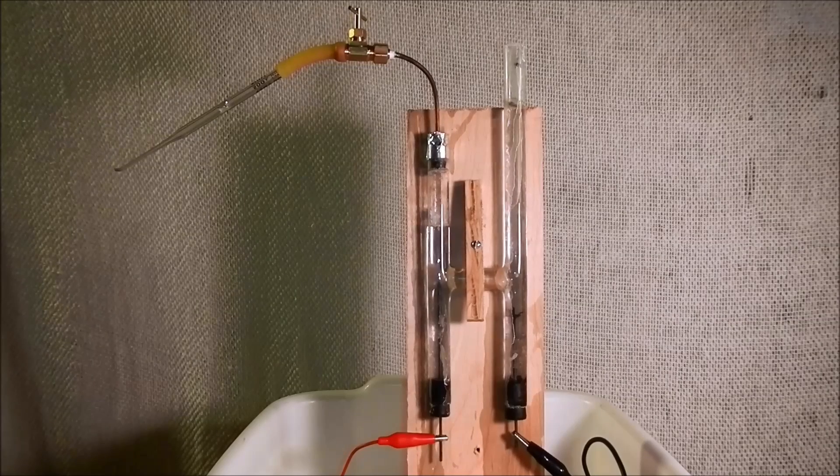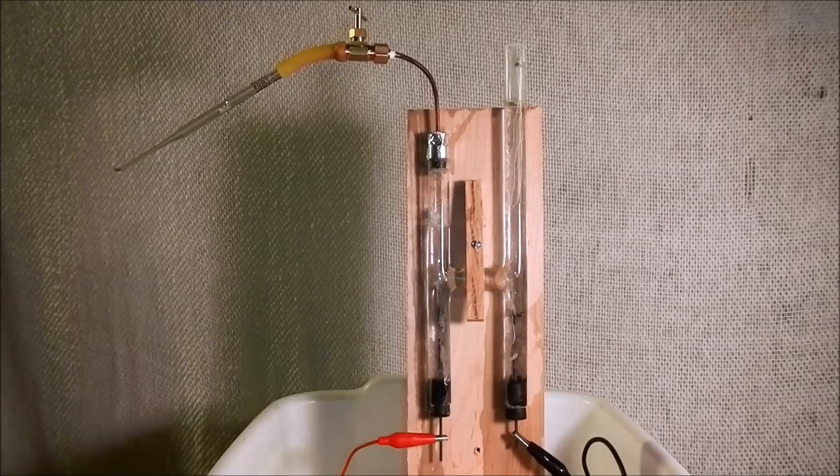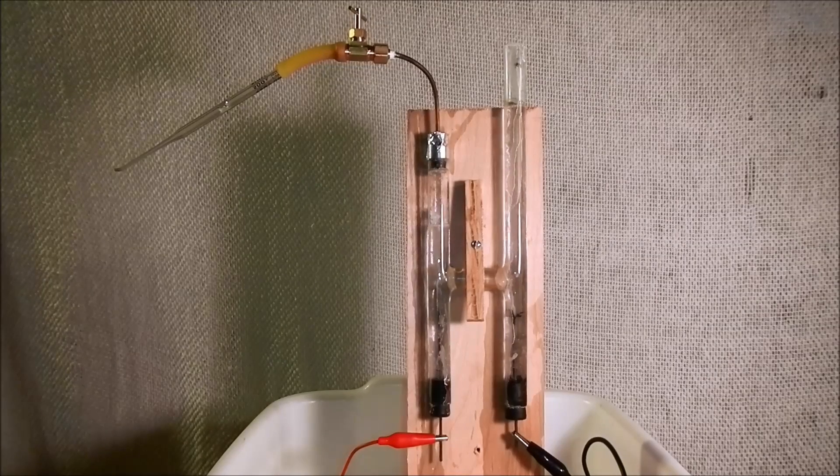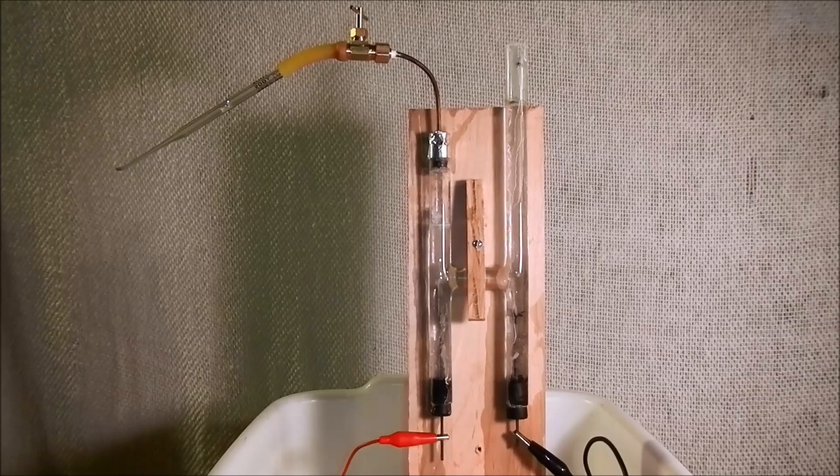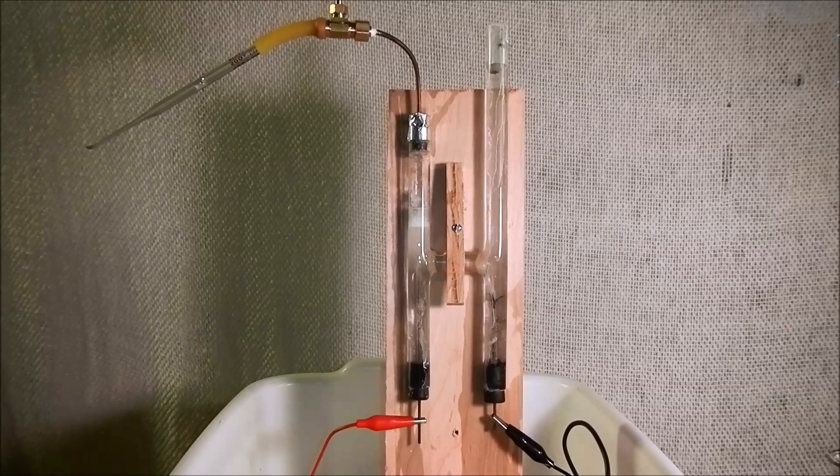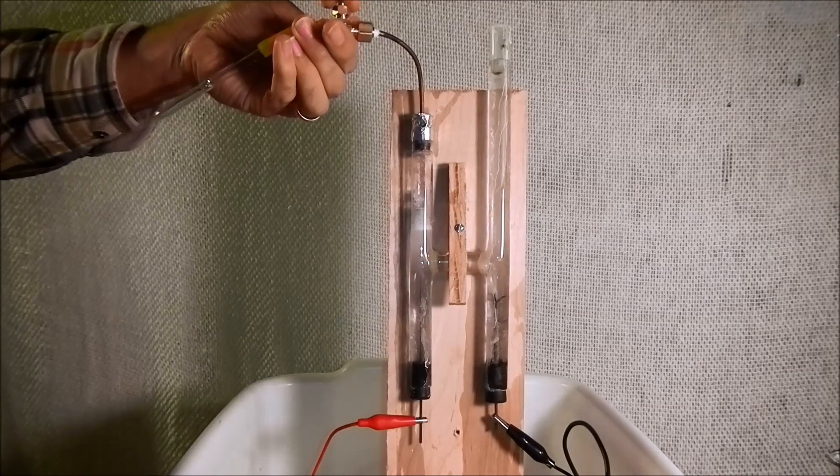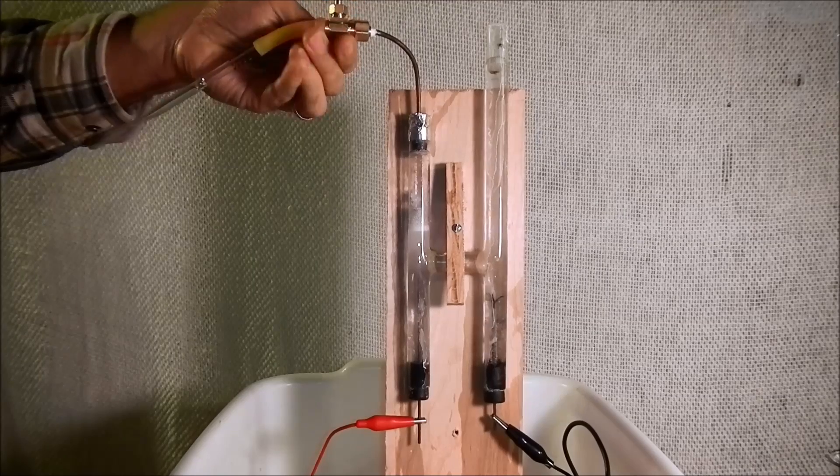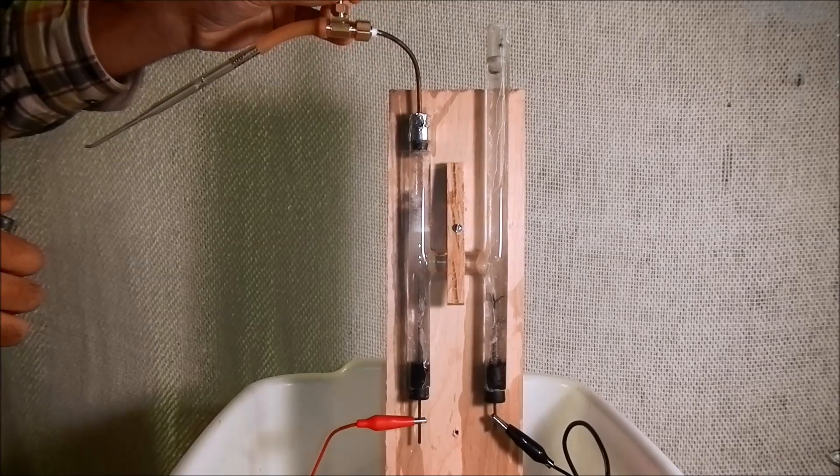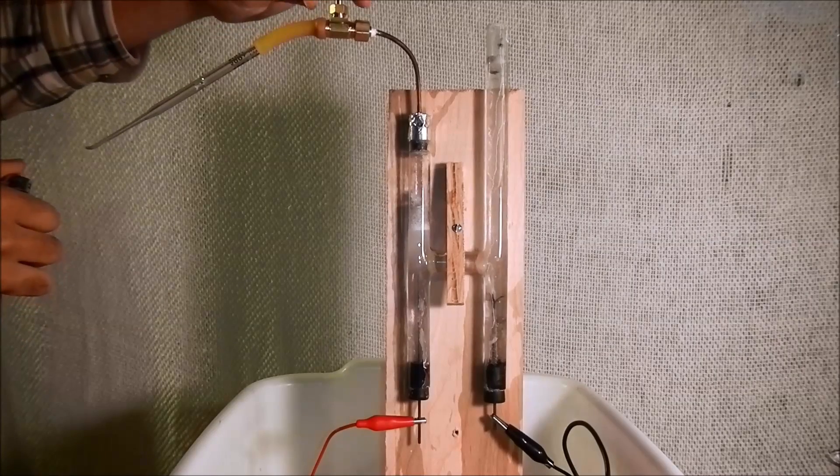Alright, so I'm applying power to the Hoffman apparatus. Our electrodes begin bubbling. I'm going to try to ignite some of the hydrogen here. That's right.